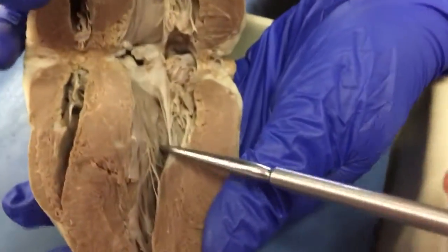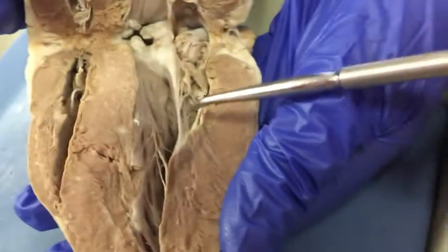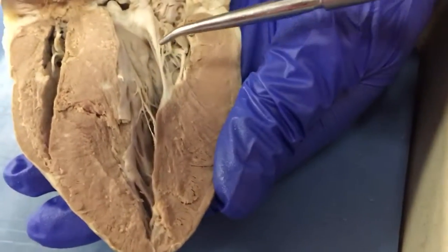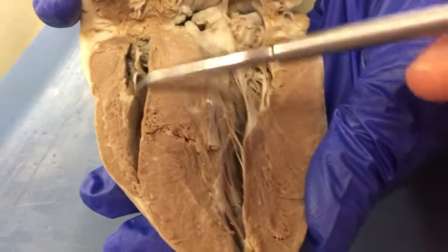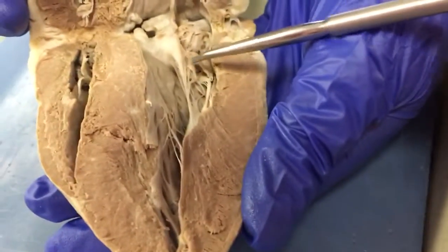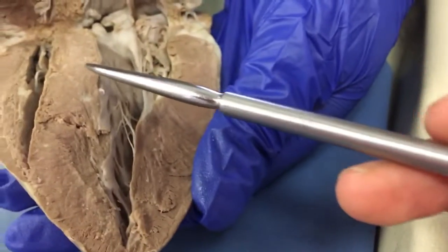Okay. On the inside, I'll just reiterate what Karmen said. This stringy portion is the chordae tendineae, and the part that it's connected to down here is the papillary muscle, and then it's connected up here and up here to the valves. So when the papillary muscle contracts, it pulls the chordae tendineae, and it controls the opening and closing of the valve. So it controls blood, and it regulates blood flow through the heart.